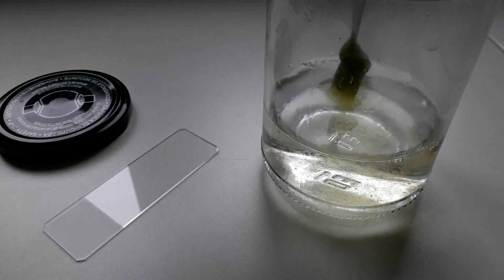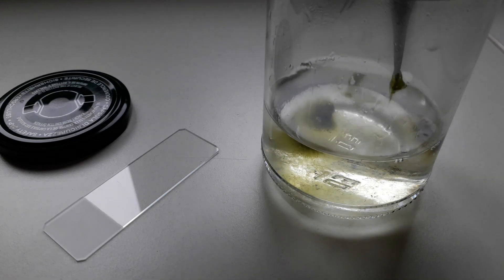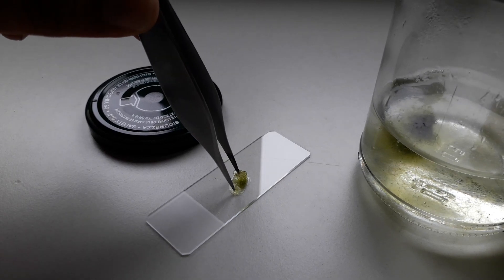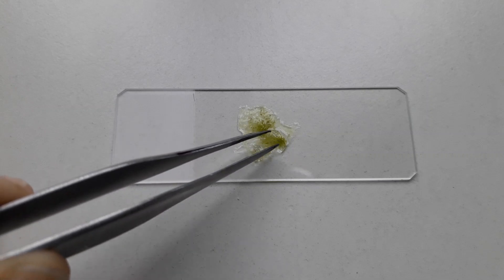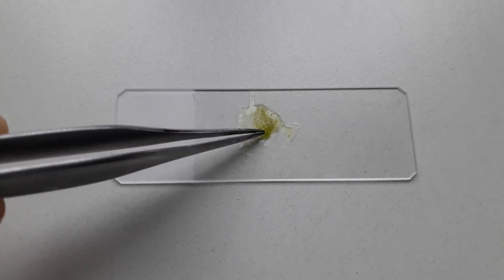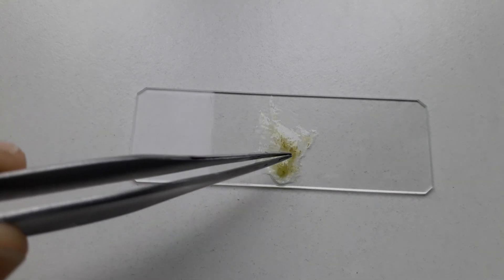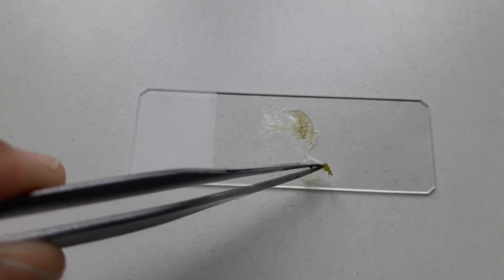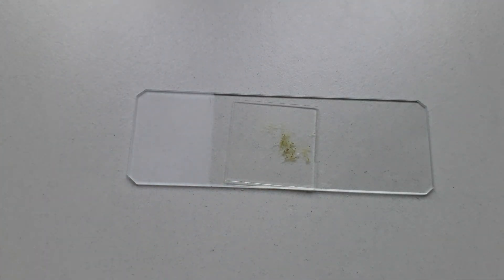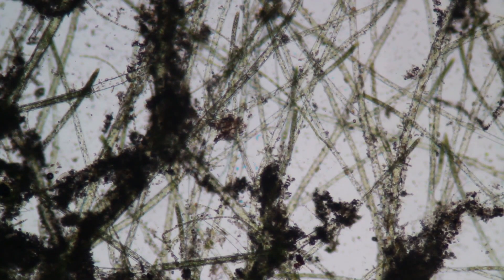Back at home — pretty self-explanatory. I took out the algae; they're pretty long and very inconvenient actually, so I had some problems separating and making them a little bit smaller. I placed a rather large sample on the slide and carefully separated it, but then I had to remove quite a bit because otherwise it's going to be too thick and the microorganisms are going to float up and down. Sometimes less is more, because we can then have a much easier time seeing them. The cover glass goes on top and everything goes under the microscope. At low magnification it looks pretty messy.